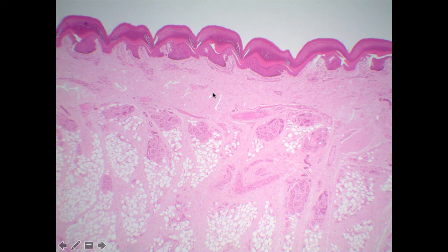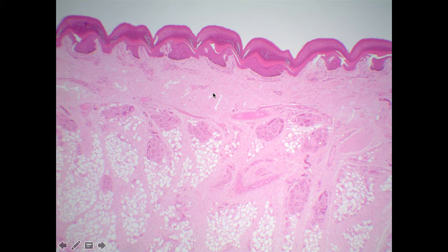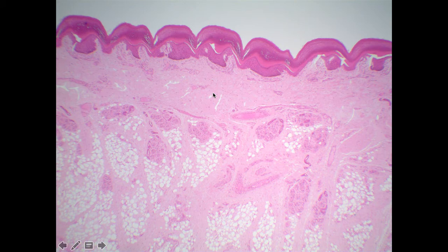Unlike the previous labs where we were focused on specific tissues, this is the first lab where we are going to be observing a whole organ. It turns out the skin is an organ — the largest and fastest growing organ in the body. Because it's an organ, it's going to be composed of really all the different tissue types. Today we're going to be seeing examples of epithelial tissue, a few of the connective tissues, but also nervous tissue as well as muscle tissue that help contribute to the overall function of the skin.